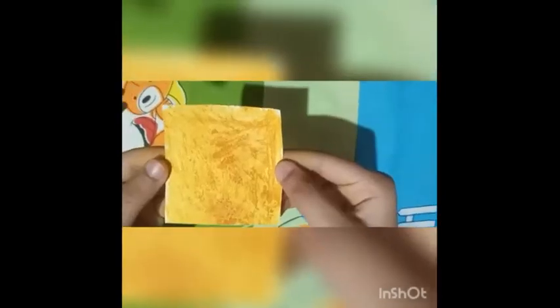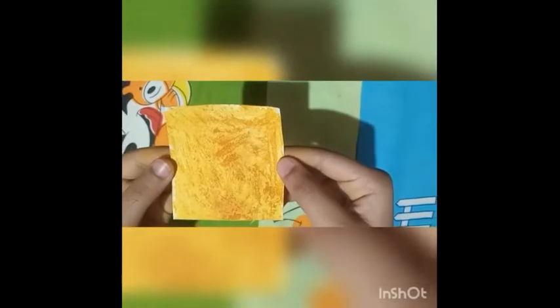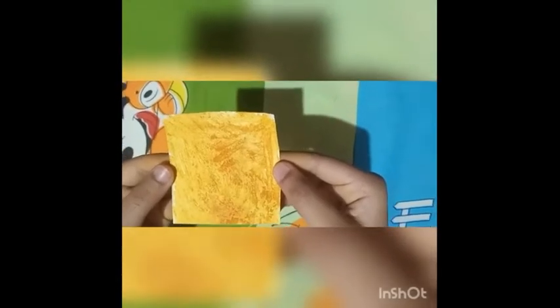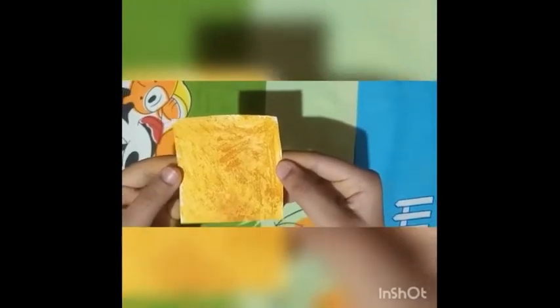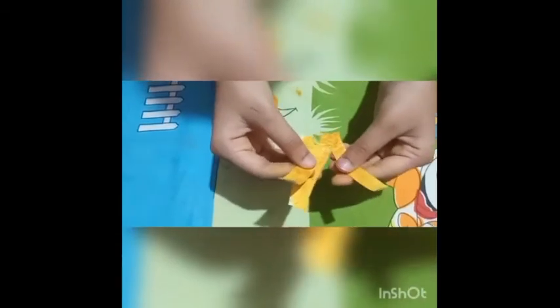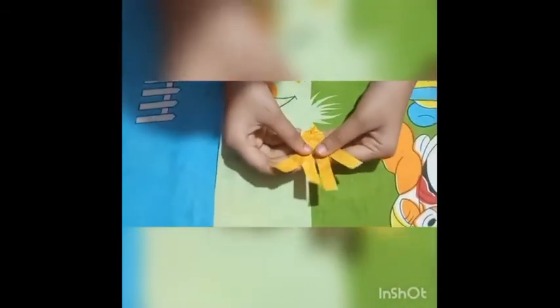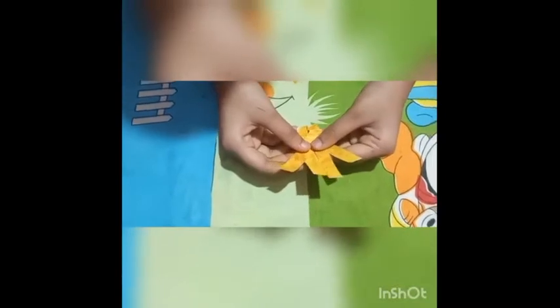Sometimes the dry sheets look like this. Now you can cut them into small strips. The strips are ready, and we are also ready with our activity.